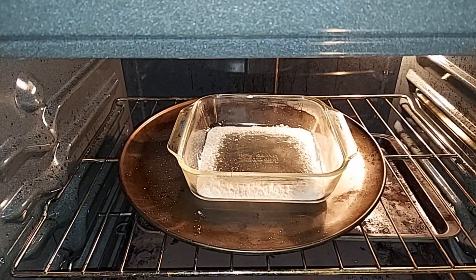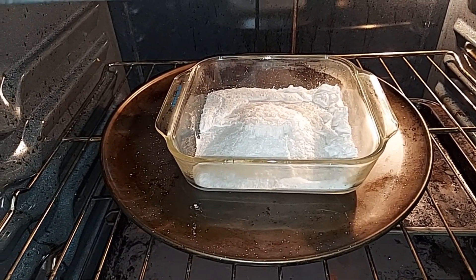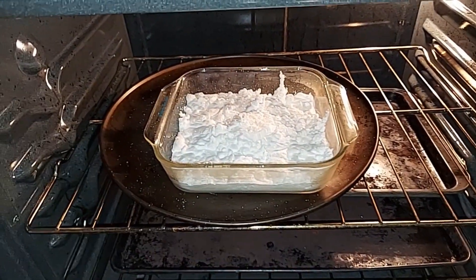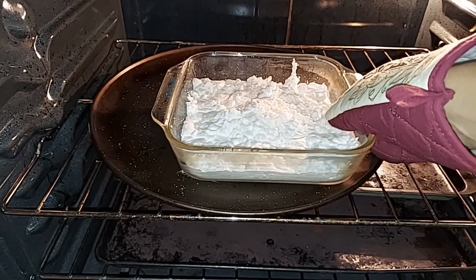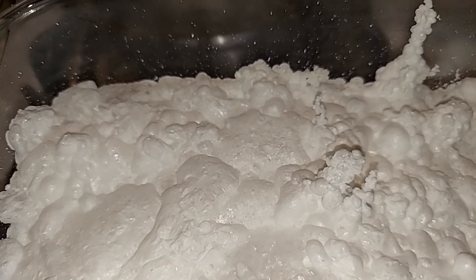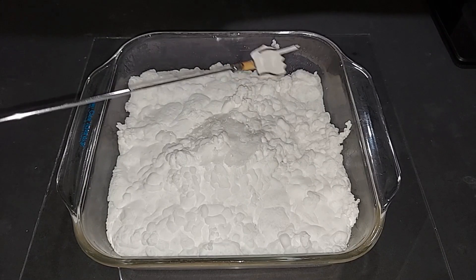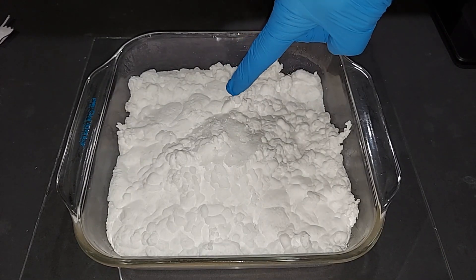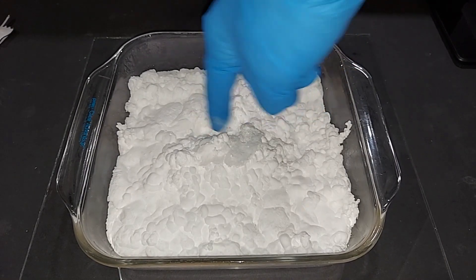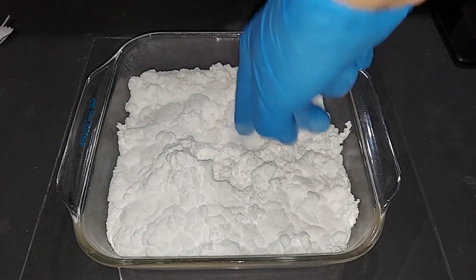30 minutes in, everything's melted. One hour in, we're starting to lose some water. 90 minutes later, we've lost a lot of water — there's likely some on the bottom still, so I keep heating. Just over two hours in, it looks like all the water is gone. Anhydrous sodium acetate is this fine white powder. I'll break it up completely and weigh it.